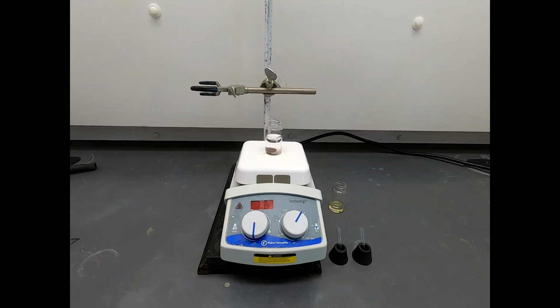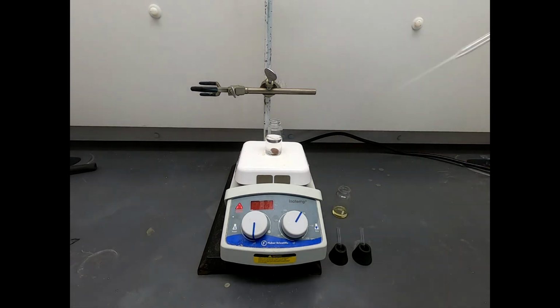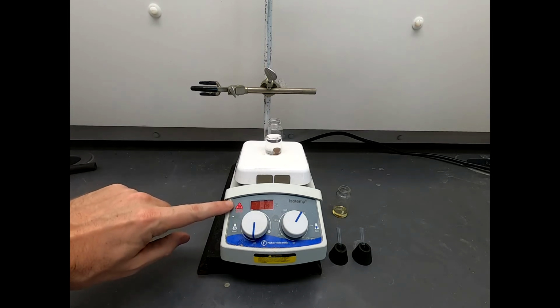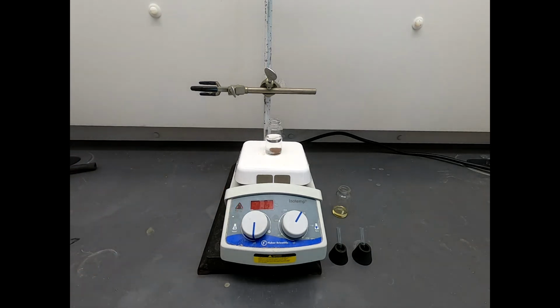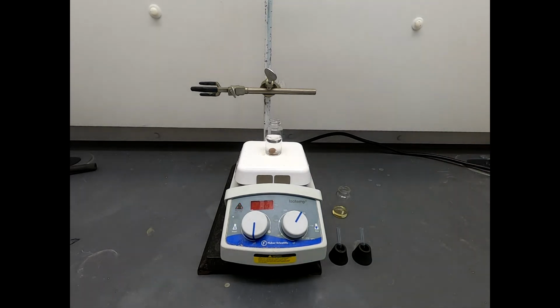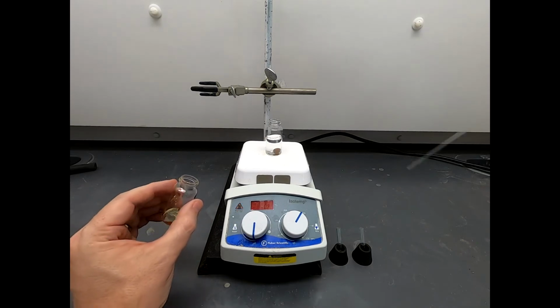For the next step of the reaction, it calls for addition of our reaction mixture to water, a volume of water. That's about 12.5 milliliters of water. Now, if you'll notice, I've got a little red light on the hot plate. So I've turned off the hot plate, but that means the hot plate is still a little bit warm. It could actually still be very hot, but it's not very hot. But it is warm. As we add this mixture, eventually we're going to get precipitation in this flask. And actually, precipitating from a warmer solution is sometimes a little bit more advantageous than just keeping things as cold as possible. So I'm not going to worry about that little bit of heat.